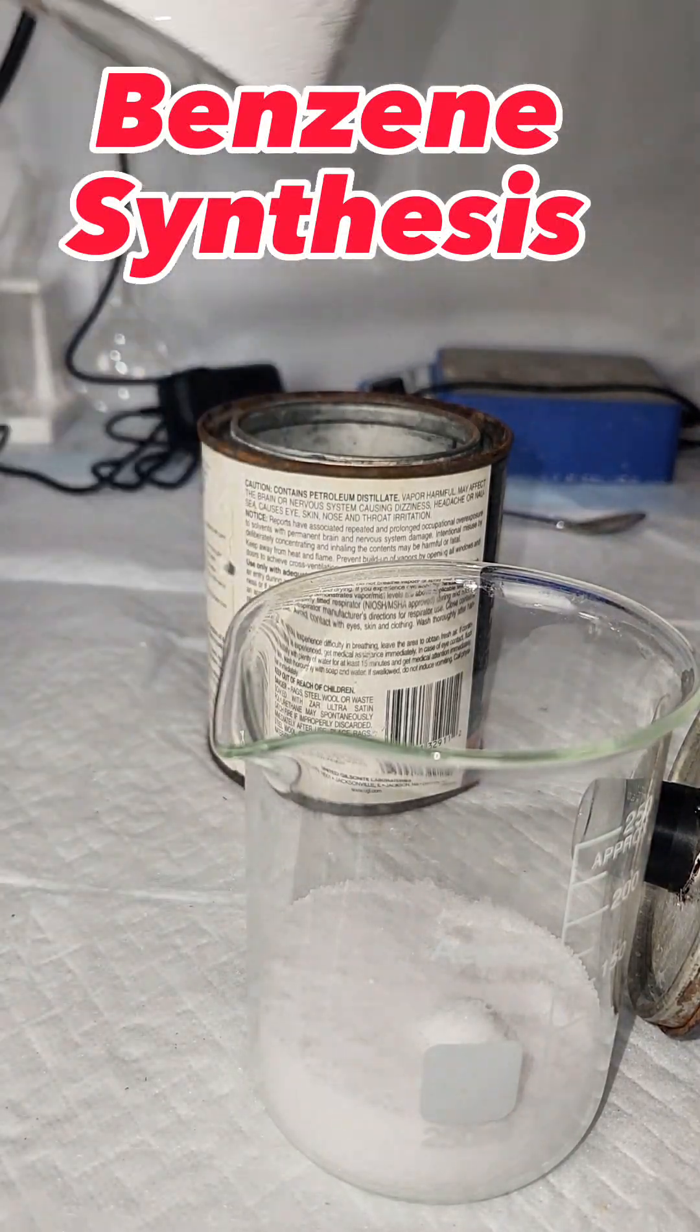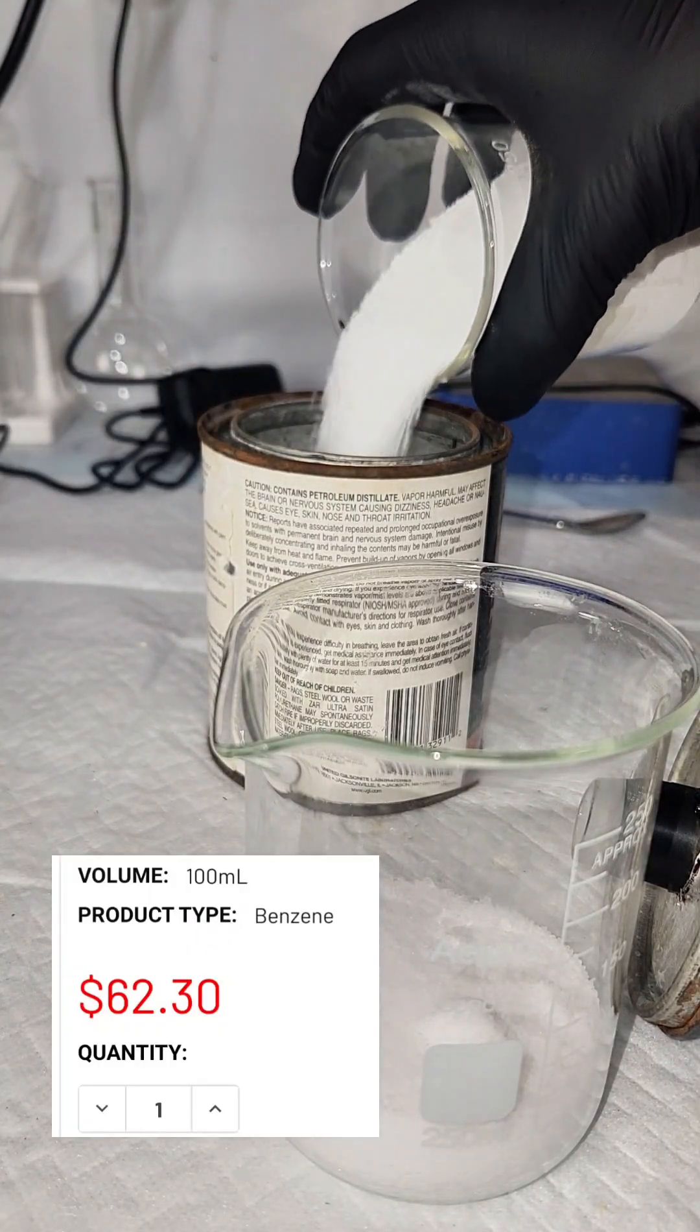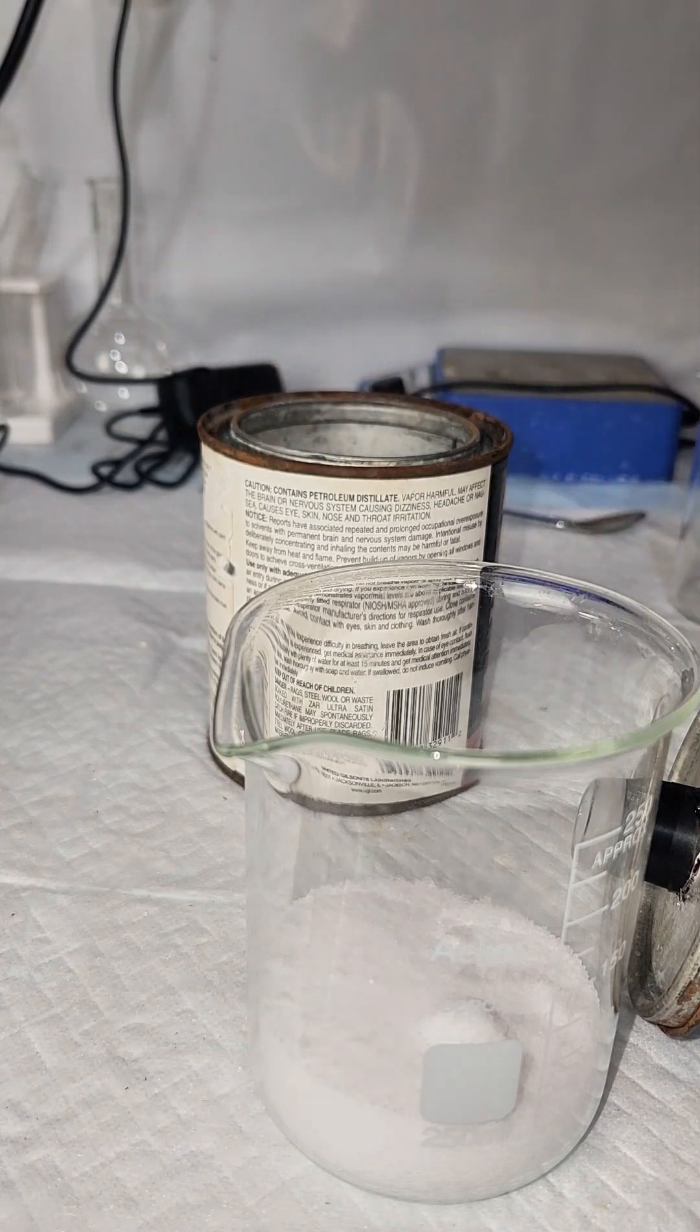I need benzene for a project I'm working on, and as it turns out, benzene is really expensive, so I'm just going to make it myself.